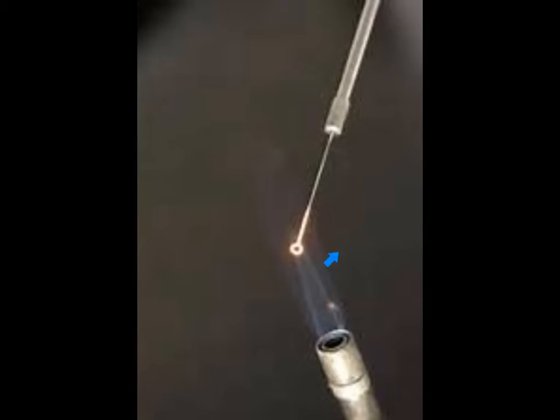We want to do that by maintaining the flame loop in the heat source until the loop is nice and red, and then allow it to cool before we set our flame loop down.